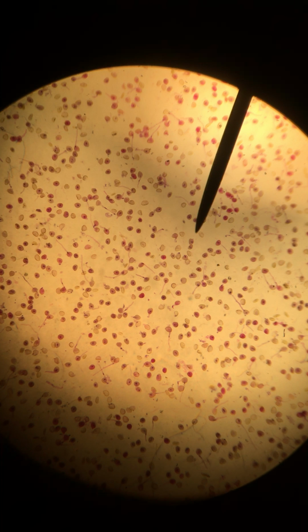This is slide 4, pollen tubes. The only things we need to see on this slide are the pollen grain and the pollen tube. Right now we are at our lowest magnification. It's about 40x, and at this point all we can really see are maybe some circular shaped structures and some little tails extending from some of them.